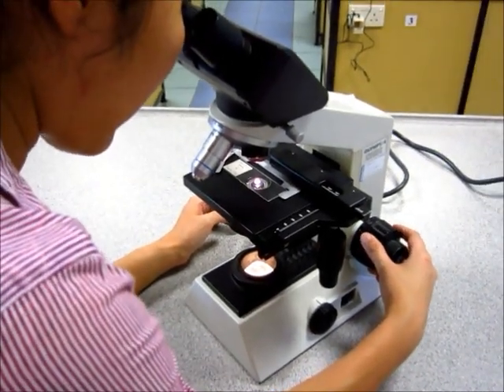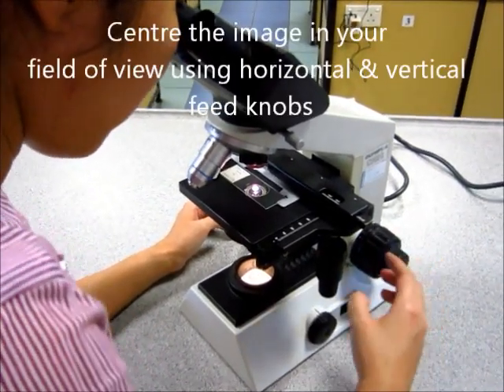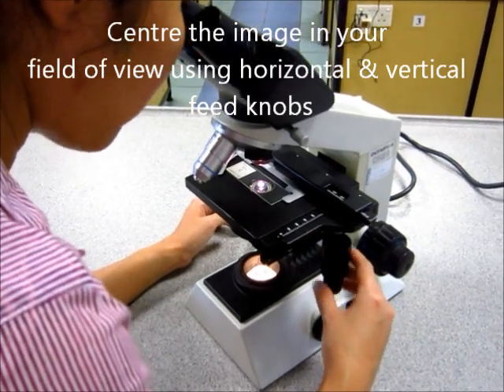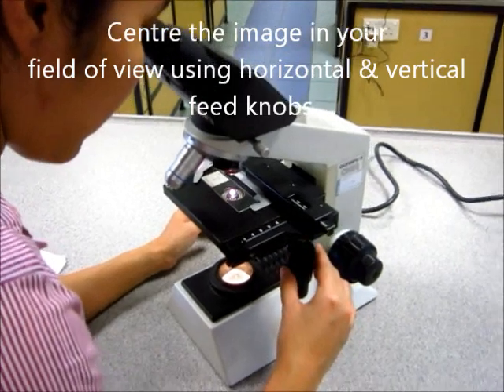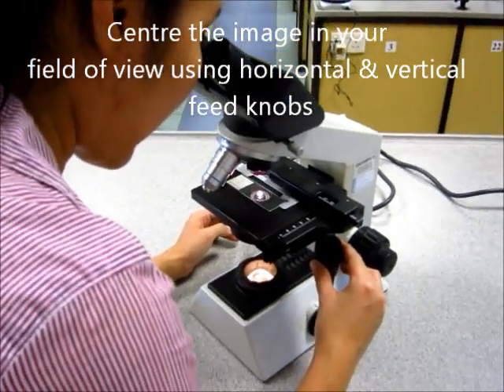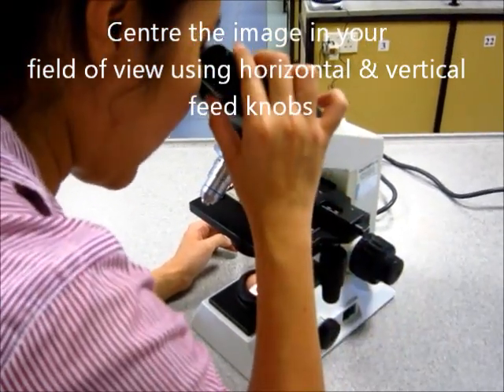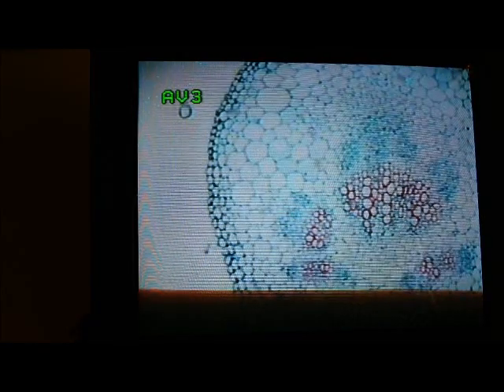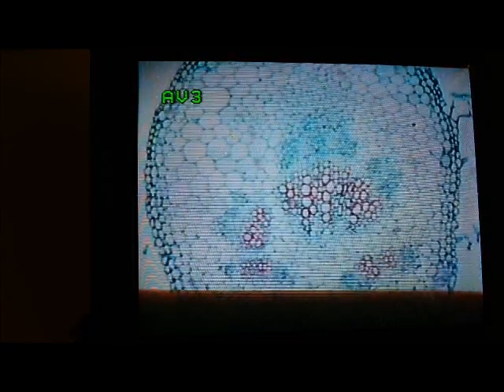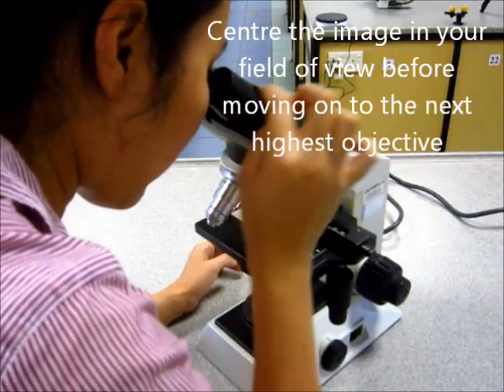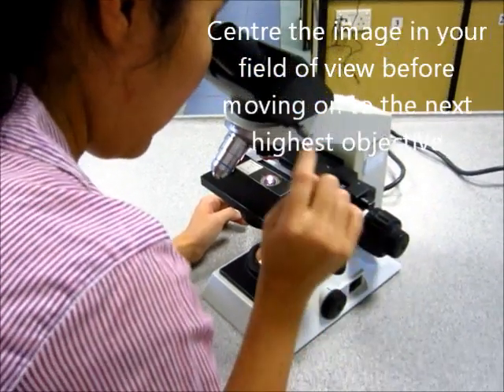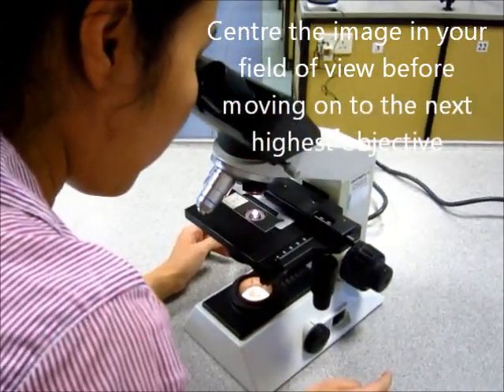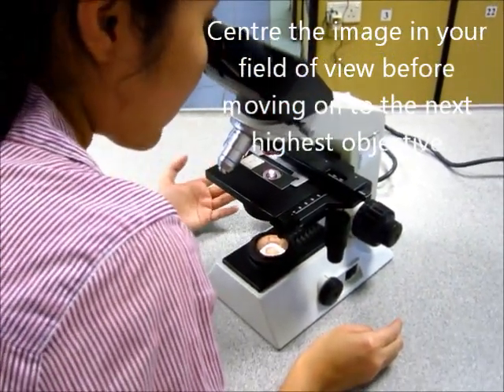Once it comes into focus, you may also still want to do a slight adjustment to make sure that whatever you see is now in the center of your field of vision inside the eyepiece. Only when the image is in the center of your field of vision do you increase the objective.